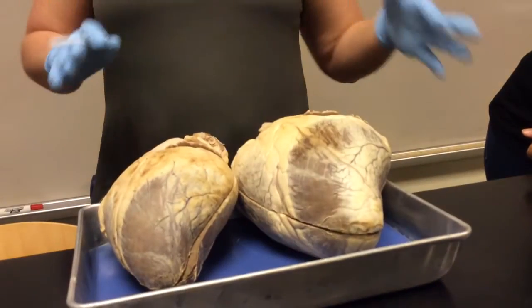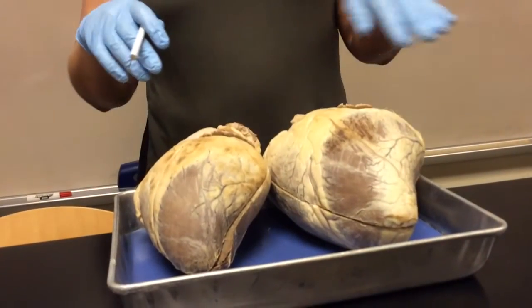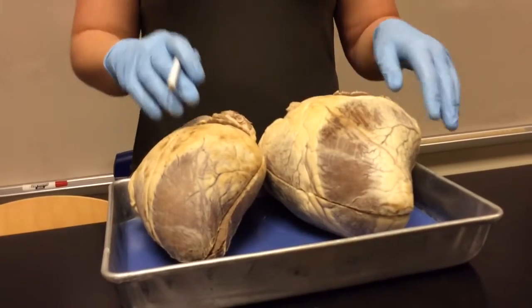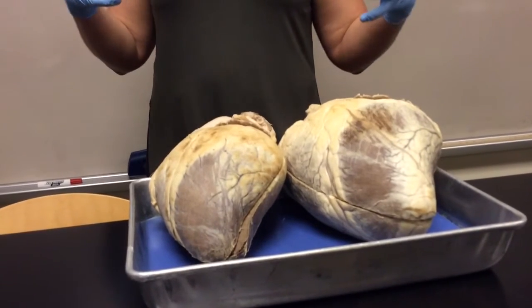All right, so what else? Now I'm going to start with the pathway of blood. And as I go through the pathway of blood, we'll come full circle. We'll end where we started. I'll also point out all the structures along the way that you have to identify on the cow heart. So first I'm going to start at the lungs. So blood is in our lungs, in the blood vessels of our lungs.